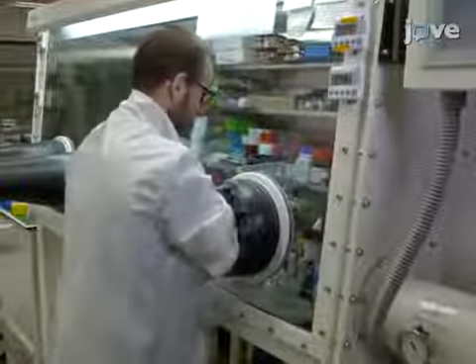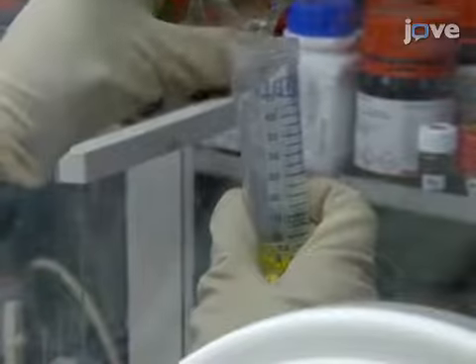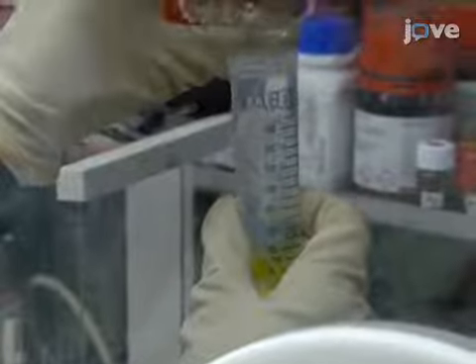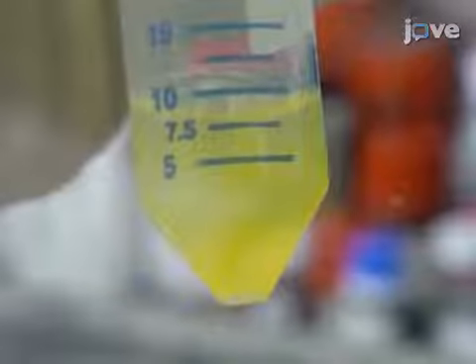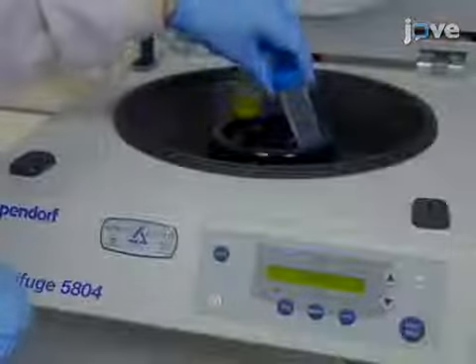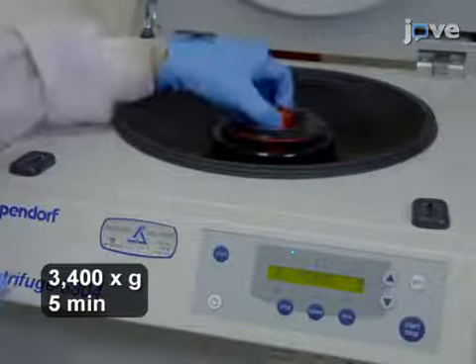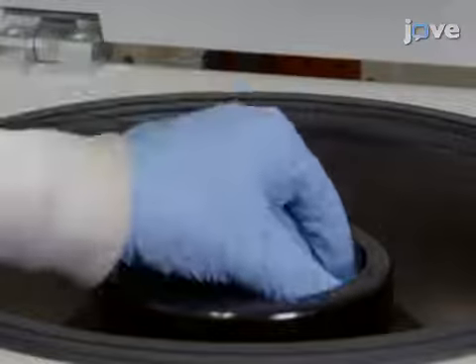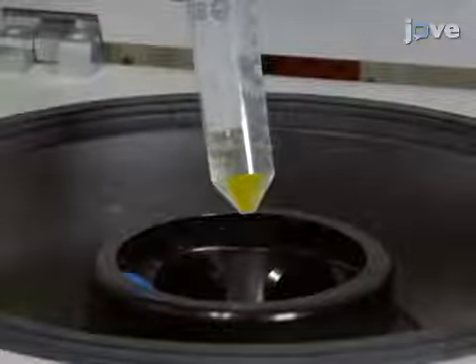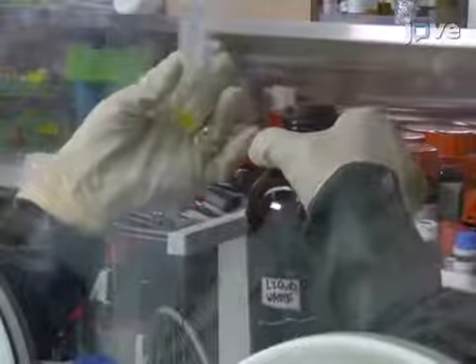To start, first synthesize cadmium sulfide cadmium selenide seeded rods, and then suspend them in toluene solution indicated in the text protocol. Transfer about half of the solution to a centrifuge tube, and add up to a 1/2 volume of methanol to precipitate the rods. Centrifuge the tube at 3400 g for 5 minutes, and decant the supernatant. Retain the pellet for later use.